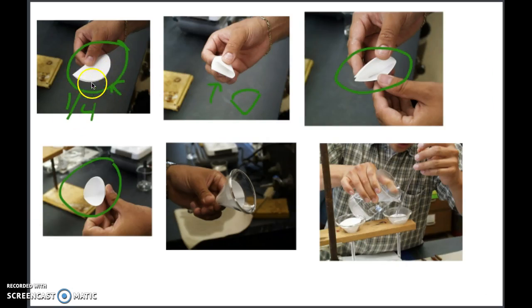This shows you really quickly how to filter the barium sulfate precipitate from the rest of the solution. You're going to fold your filter paper into quarters so it looks like this, and open one side of it so it looks like a filter, just like a coffee filter. You put that in a funnel, and then you pour the solution that contains both the barium sulfate precipitate at the bottom and the solution into the funnel to filter the precipitate. As you pour this, at the end, the precipitate should be stuck with the filter paper. The solution that you don't want should be collected at the bottom, maybe in a flask.